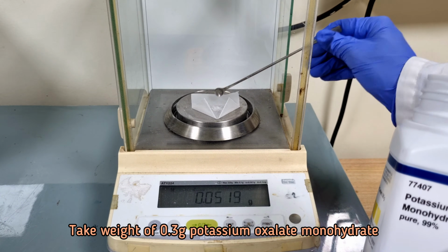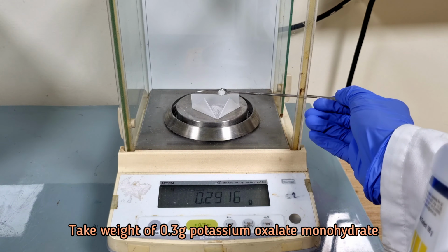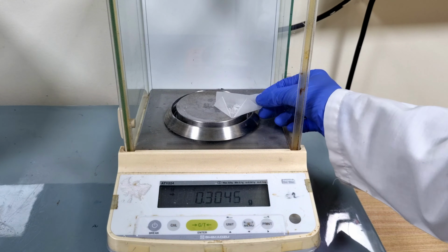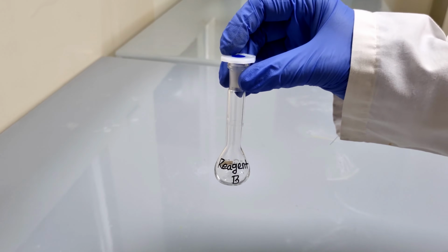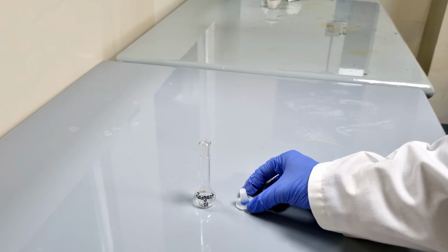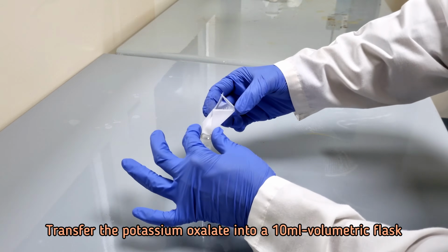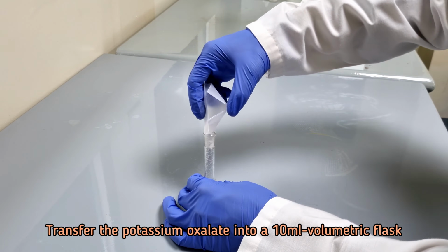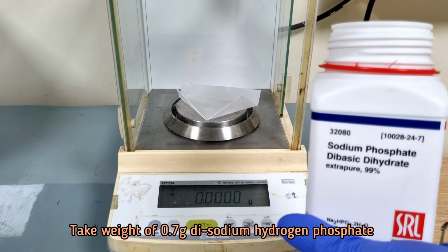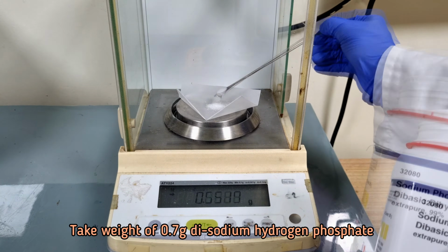Take 0.3 gram potassium oxalate in 10 ml volumetric flask. Add 0.7 gram disodium hydrogen phosphate into the flask.